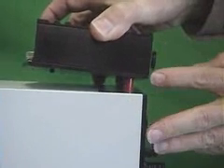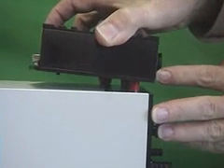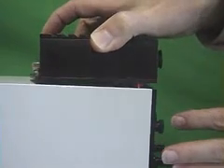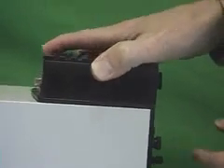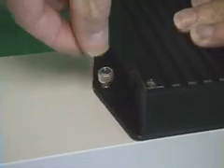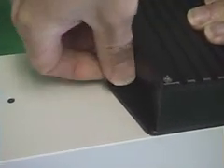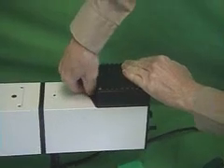These are a very tight fit. So be careful when you are inserting the connectors into the socket. Just don't jam it in. Just place them carefully until they actually fit in. Then push down on it. You may have to rock side to side a little bit like this as you are pushing down. And then push down on the thumb screw and turn it. It turns three to four turns fully down like that.